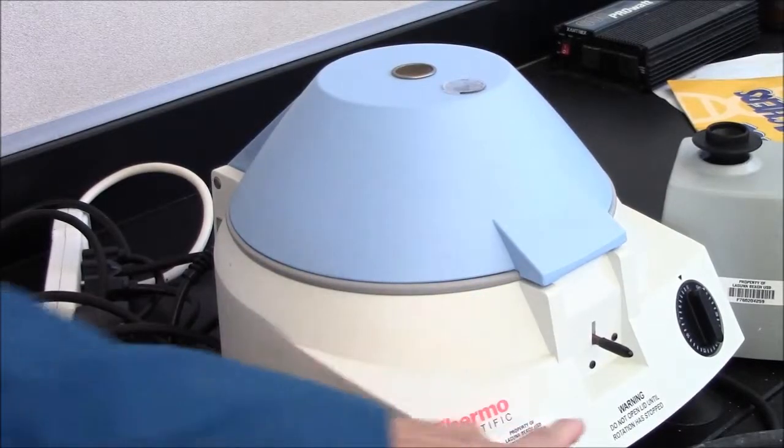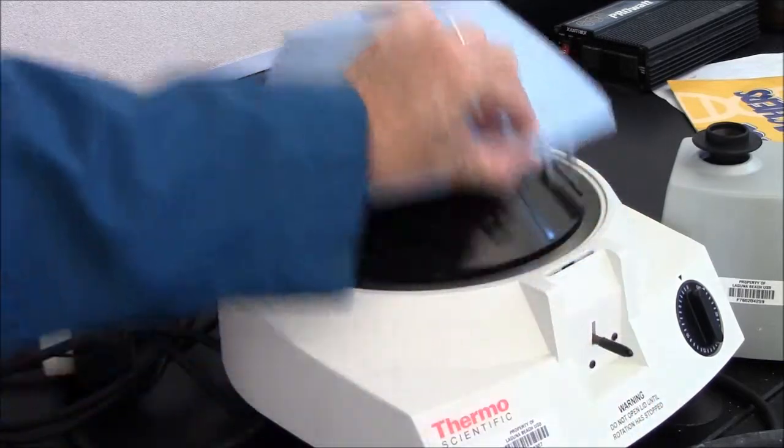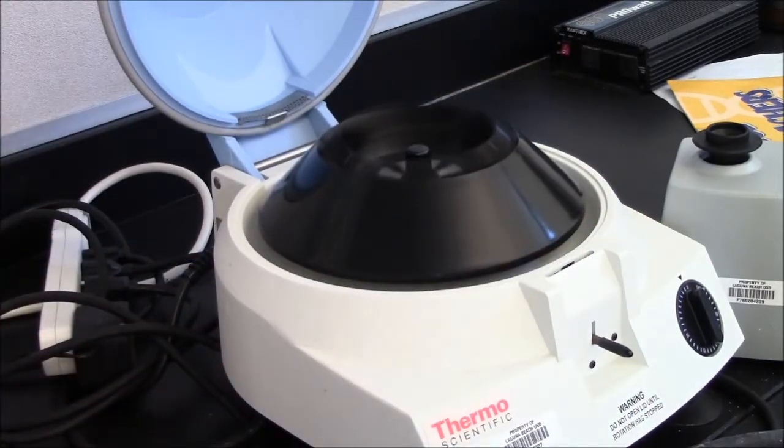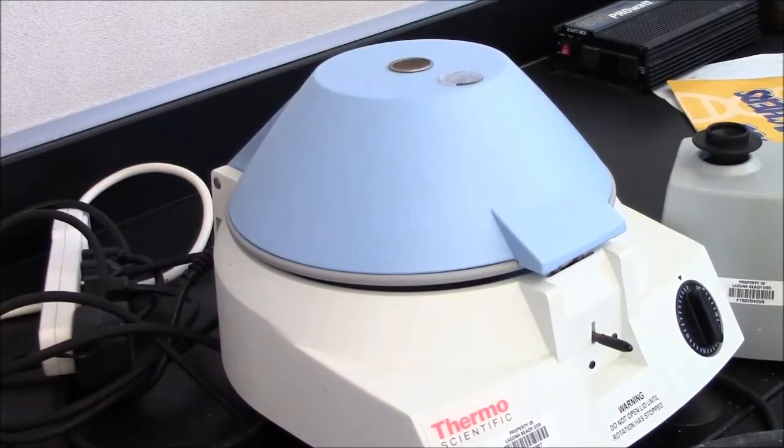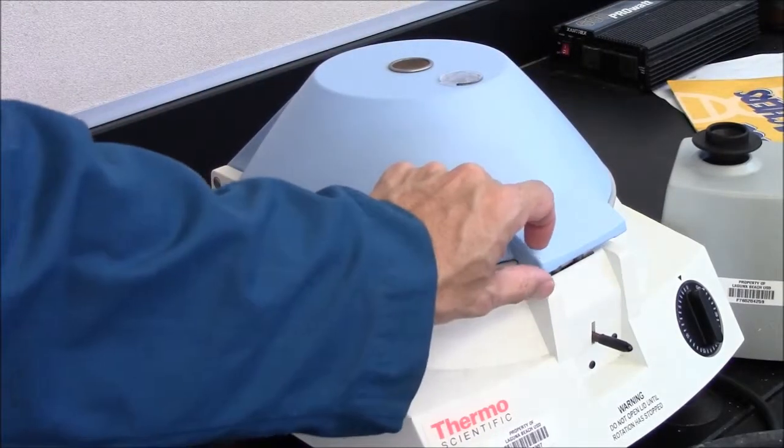Here, I will disobey the instructions and open the lid. This disk is spinning very fast and is dangerous. If you were to stick your fingers in there, break your finger. So, wait until rotation has stopped or at least gotten very slow.